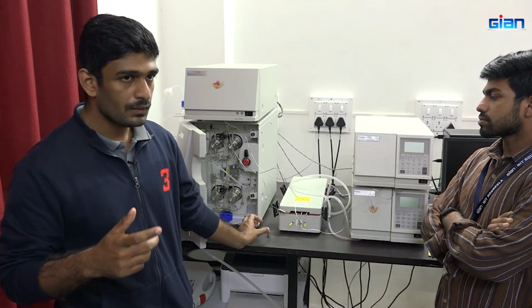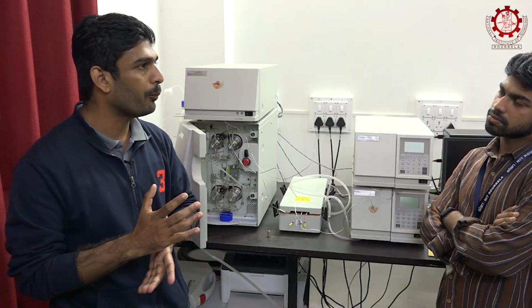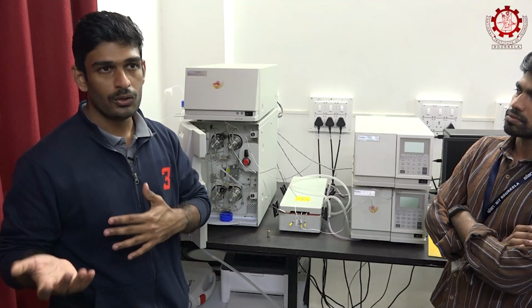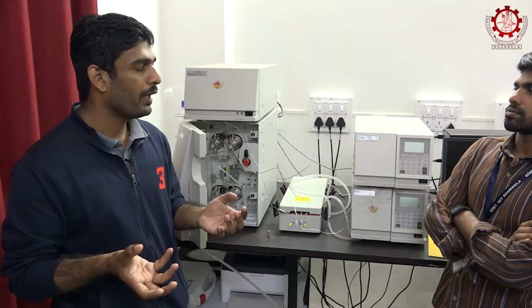Even though we filter with the Whatman filter paper, the sample should be mixed properly, and the filtering and dilution can be even 1:10 or 1:100 ratio, depending upon our requirements. If it contains a high amount of vitamin, we know roughly the range, but not exactly. In case of mass spectroscopy, that is not a matter, but in case of normal HPLC with the detector system, it will be very difficult. So we will be diluting according to our requirements.